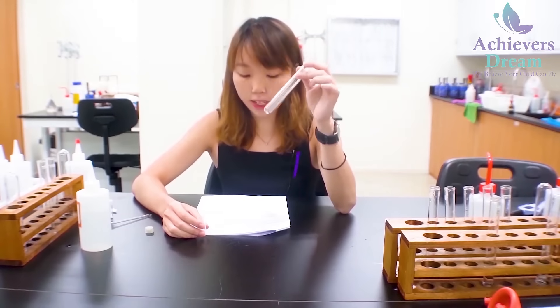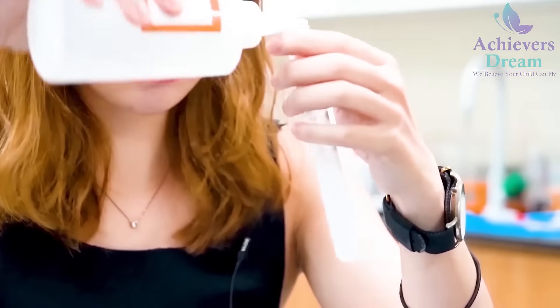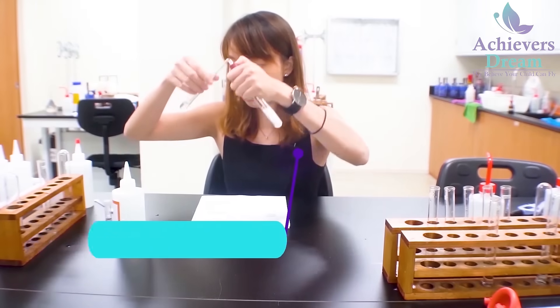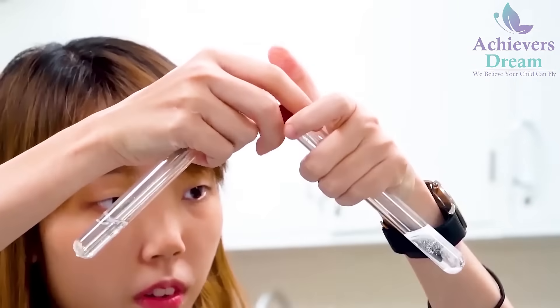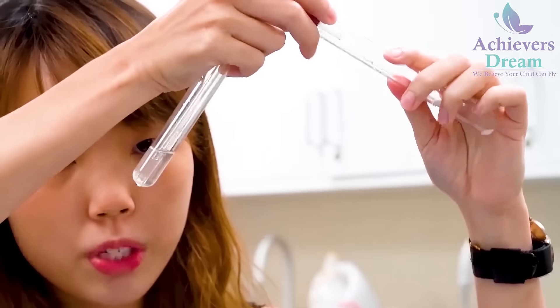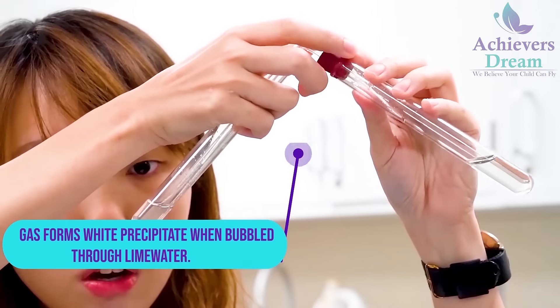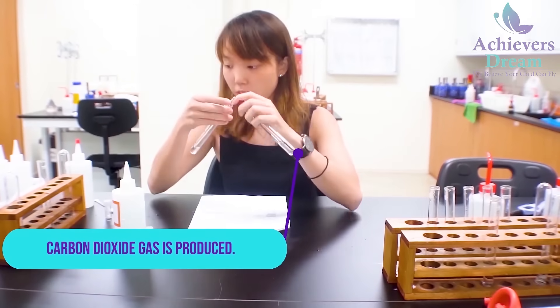Now I'm going to repeat the whole experiment using salt Y. I'm going to add in nitric acid, and you notice that there's effervescence, so I'm going to do the lime water test. You notice that there's white precipitate formed in your lime water. This indicates the presence of carbon dioxide. We are done for salt Y.